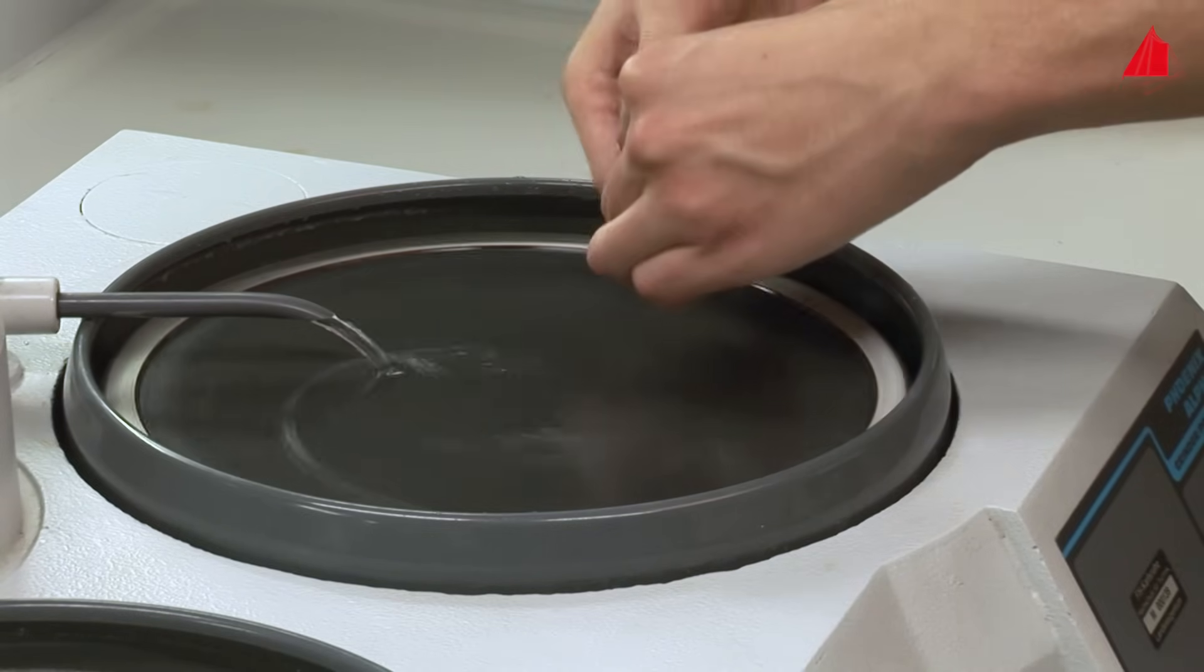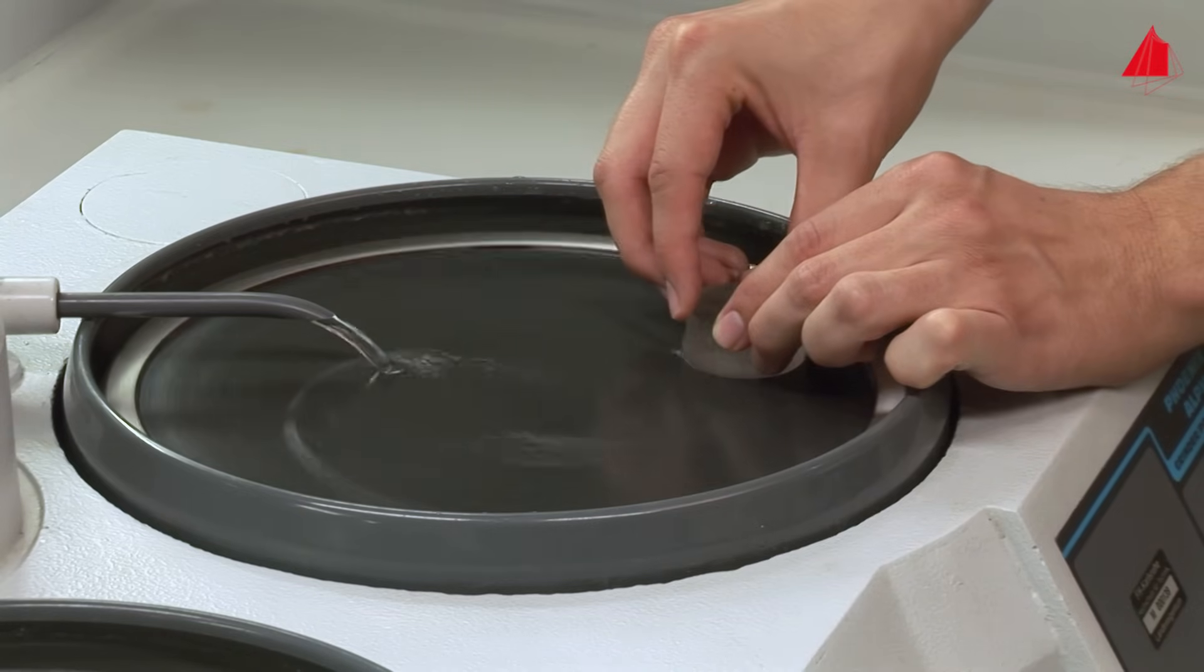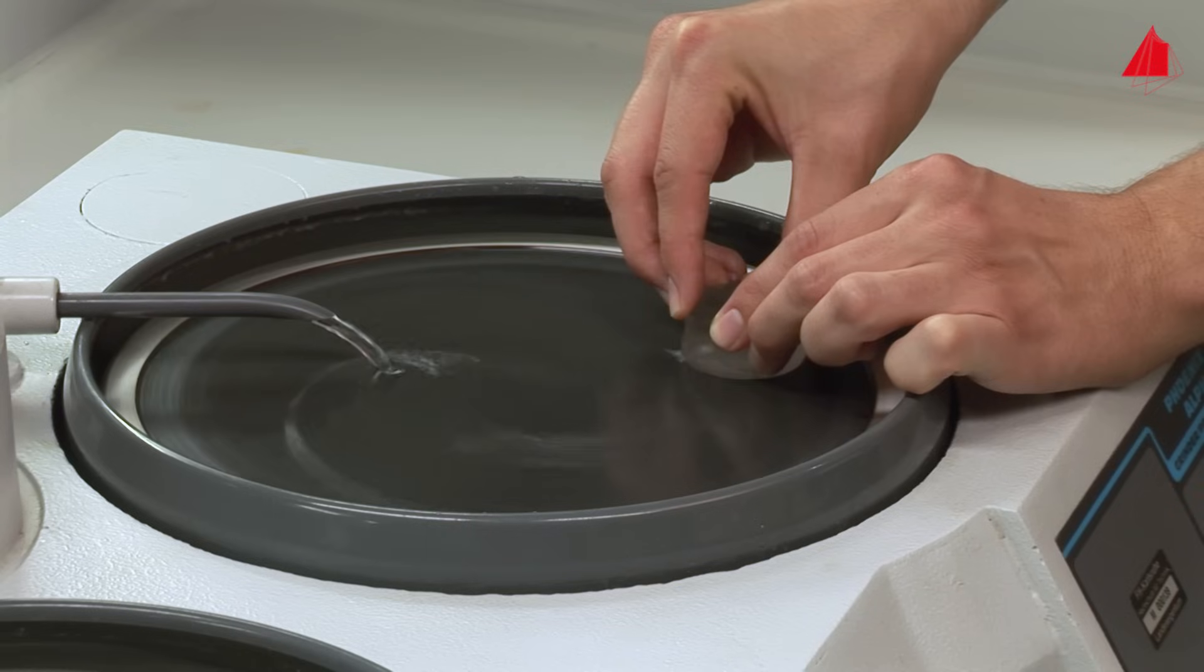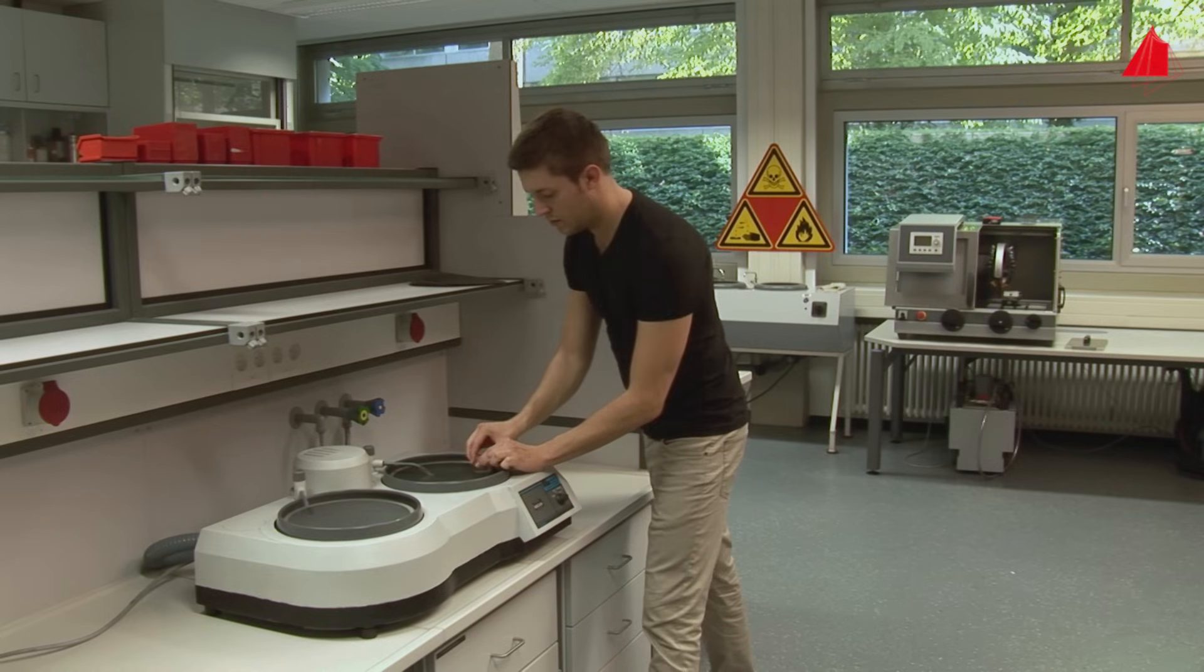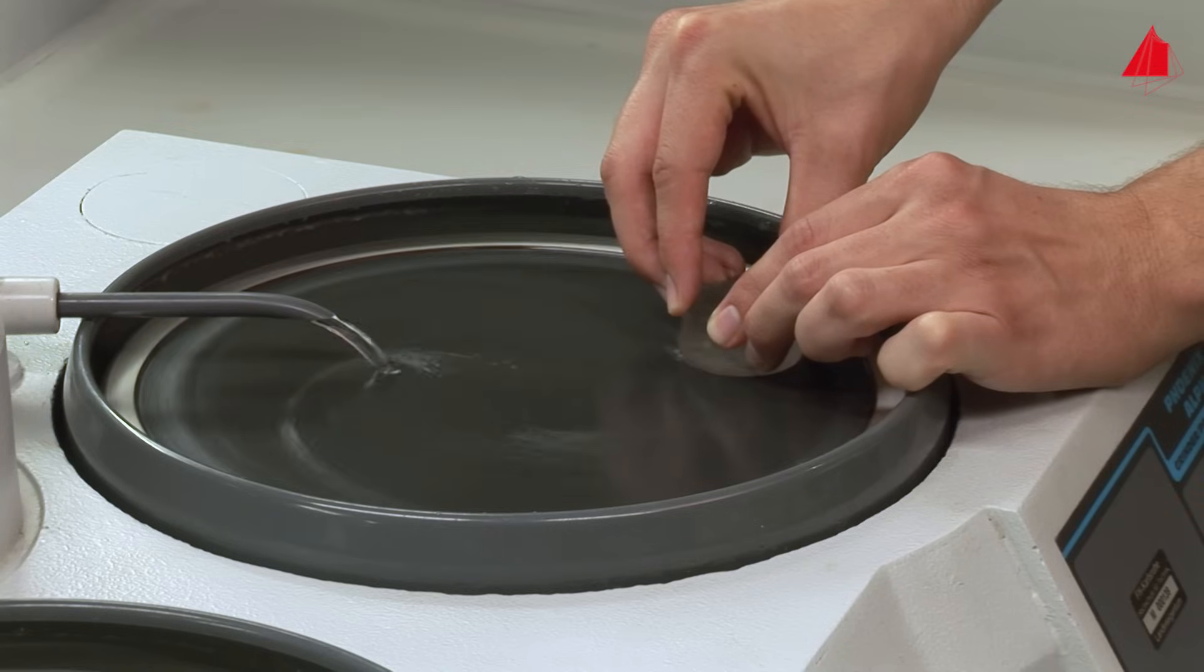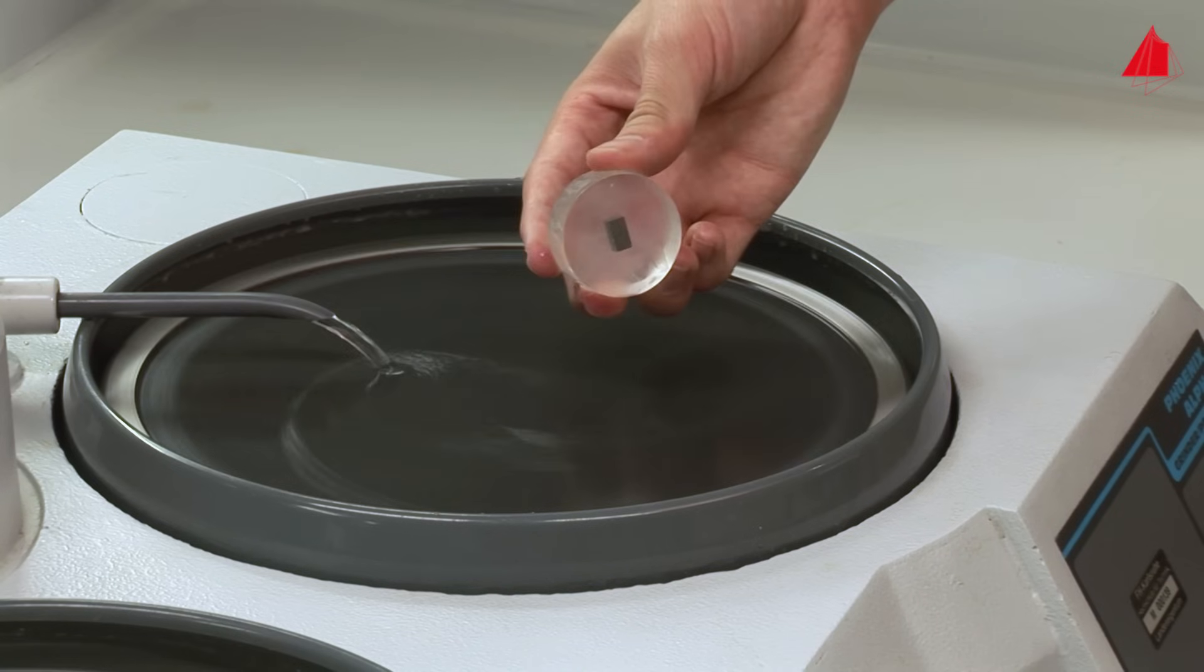Now comes the most important part, the preparation of the intended plane of examination. Our material tester begins with comparatively coarse, 180-grit abrasive paper. He makes sure to press the specimen calmly and evenly onto the abrasive paper, compensating the tendency for the sample to tilt. He also makes sure not to grind his fingertips accidentally. Now he has achieved an even, relatively rough surface.